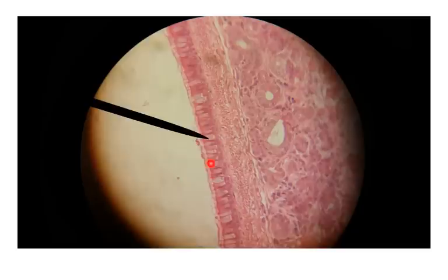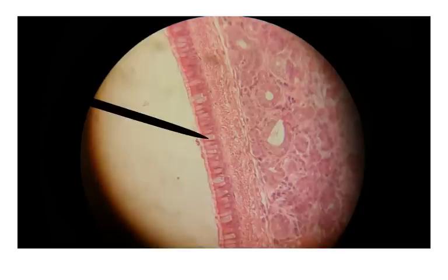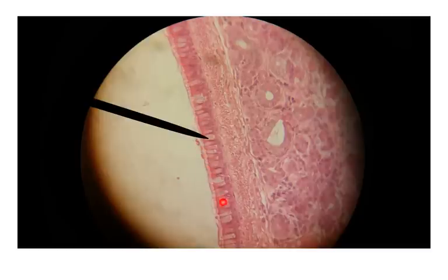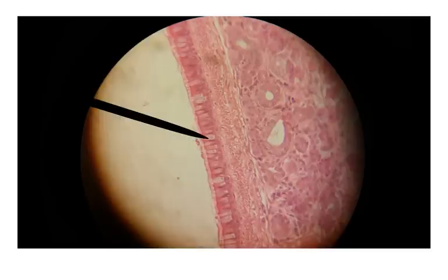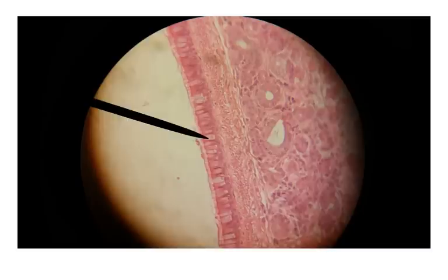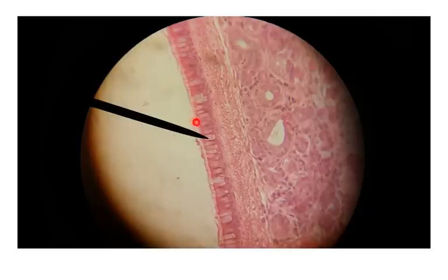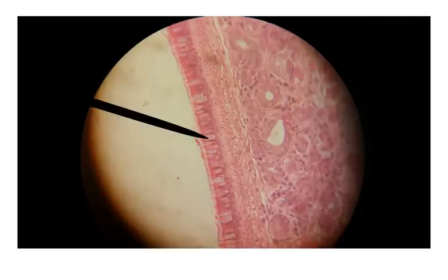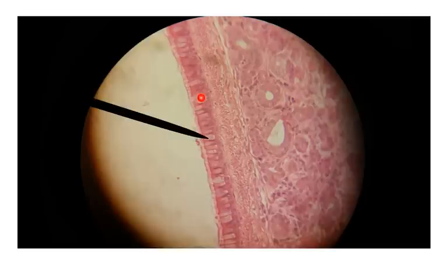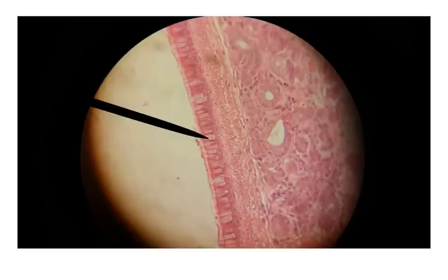Now we're going to be interested in this inner layer of your trachea. This tissue type is called pseudostratified columnar epithelium — something you saw in Biology 137 when studying epithelial tissues. Just along the surface you can see hazy material — that is the cilia that lines most of your trachea.